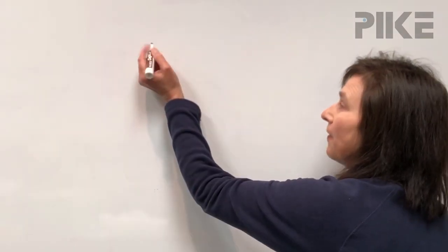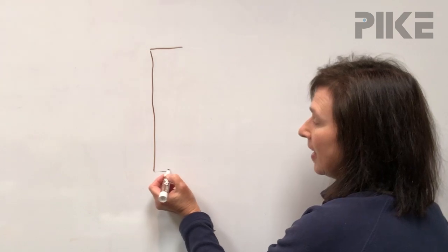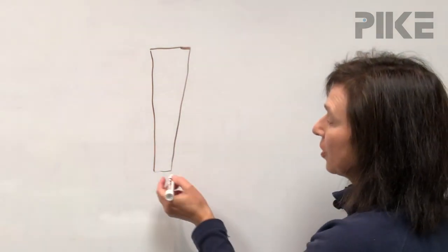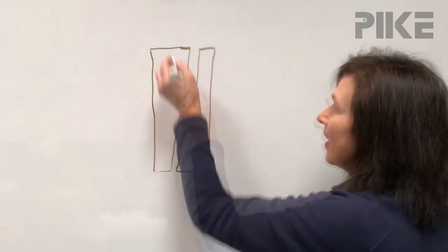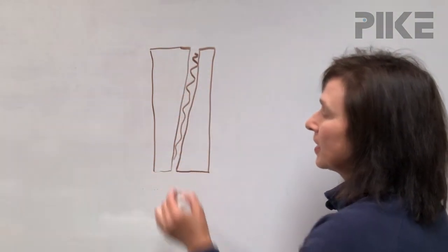Let's take a look at how to assemble a liquid demountable cell with wedged windows. Now with wedged windows, we're going to have a thick and a thin side. So when assembling the cell, we need to make sure we go from thin to thick and thick to thin. And in between, we're going to have our spacer.